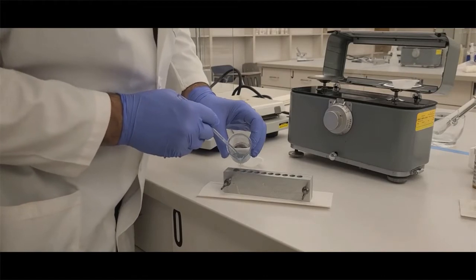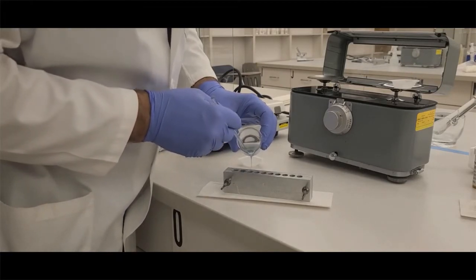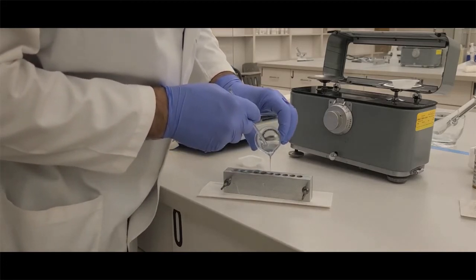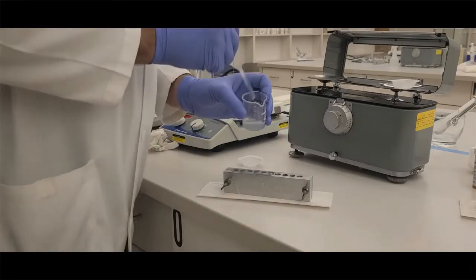You're going to see no big particles floating around—the drug is completely dispersed. Again, I'm going to do the same process. This time, I'm filling six wells of the suppository mold. I'm just going to continue filling them. If I need to stop and stir, you can, but just one continuous motion from one to another, and make sure you overpour them. That's important that we have an overpoured mess on top.